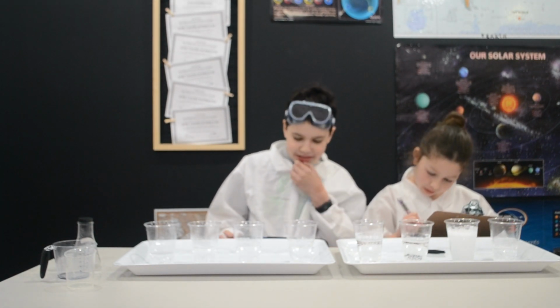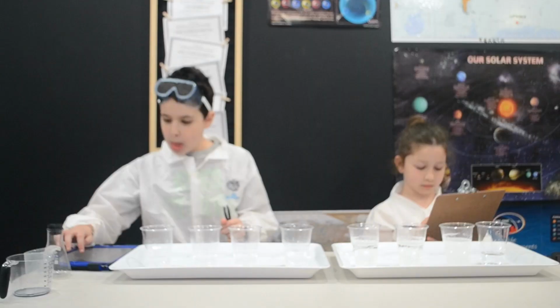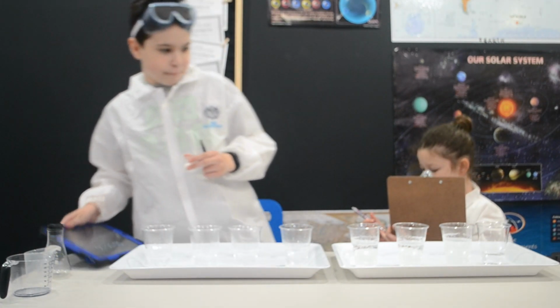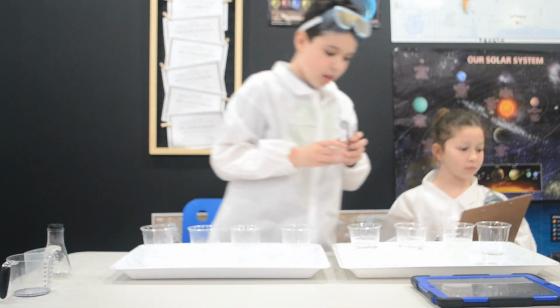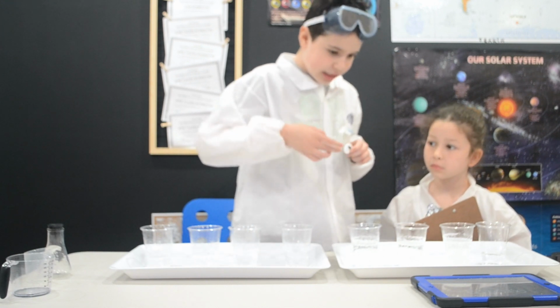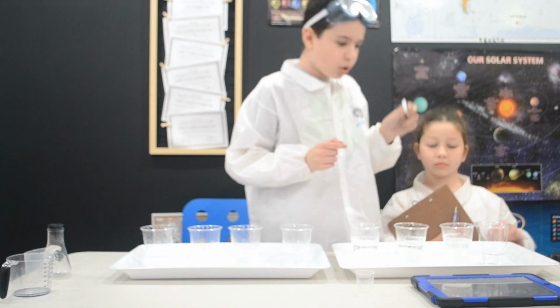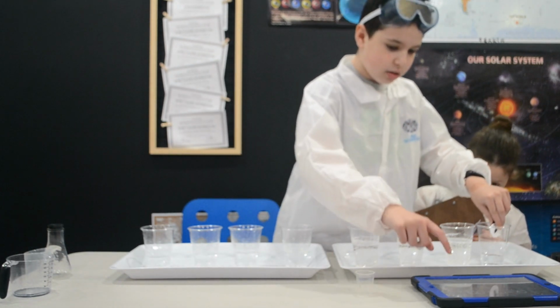So 54.47. Now we'll do a bonus with no vinegar, but 2 Alka-Seltzer tablets. Now I'll move this over here. Grab 2 Alka-Seltzer tablets at once, and then measure how long it takes. However, we'll have to double the mass, so the reaction rate still changes. 3, 2. So it should take as long as this, but you'll see. 2, 1.